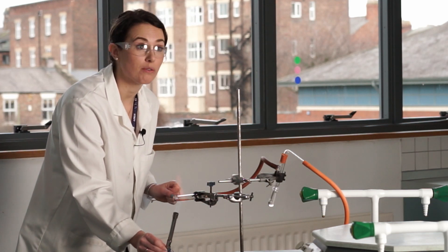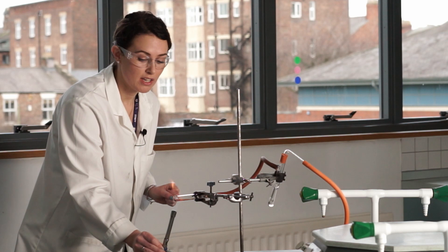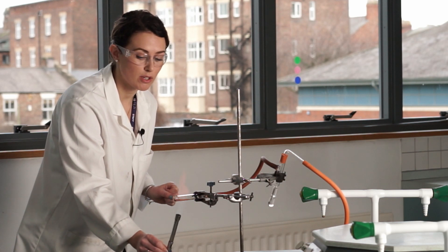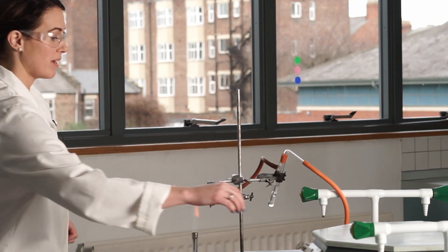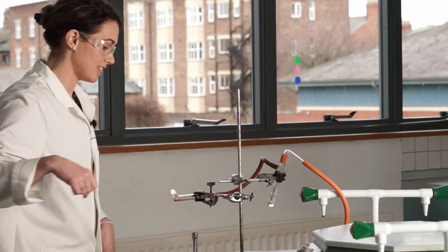I'm going to remove the Bunsen here that I'm using to heat the copper oxide directly. And make sure I turn that off. And it's nice and safe.